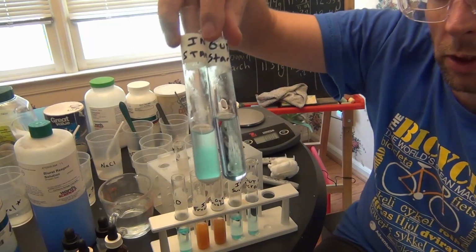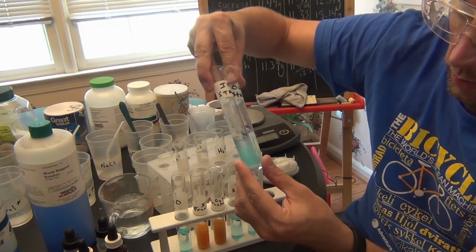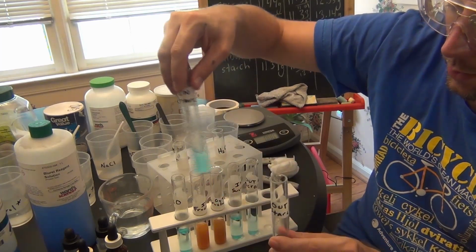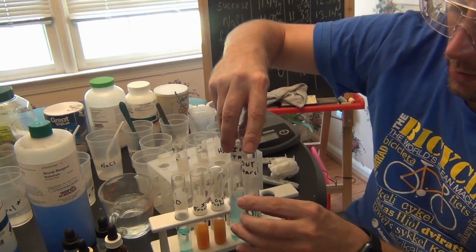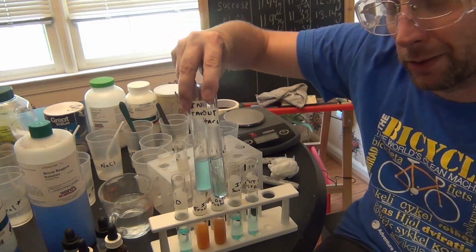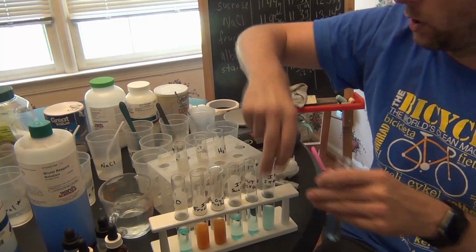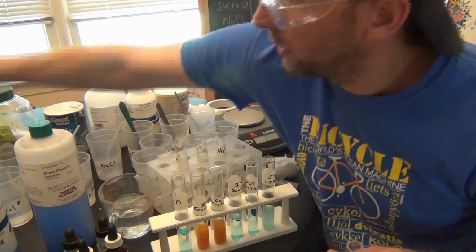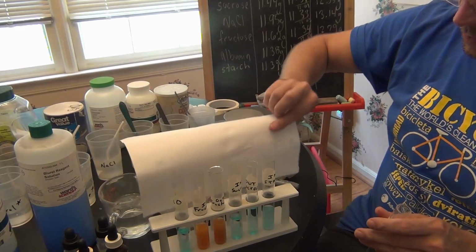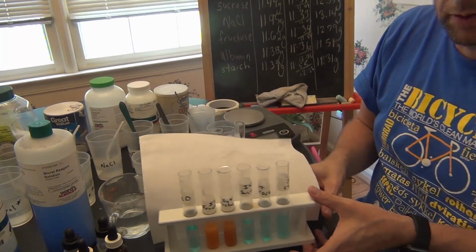You can see my one starch test got a little bit cloudy, the one with the original starch in it. That's only because that starch is going into solution better. On the outside, we already did a starch test for that, so you should kind of understand why the outside looks that way too. So I'm just going to put a light background on here so we can see our results better, and show the camera.